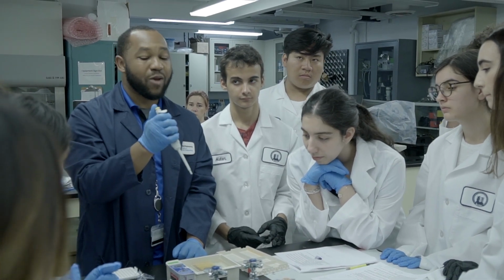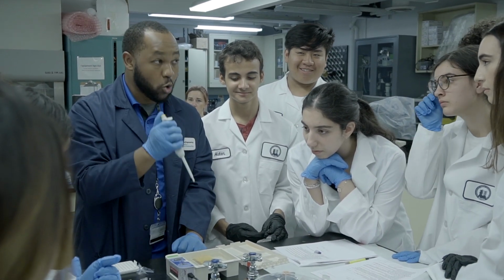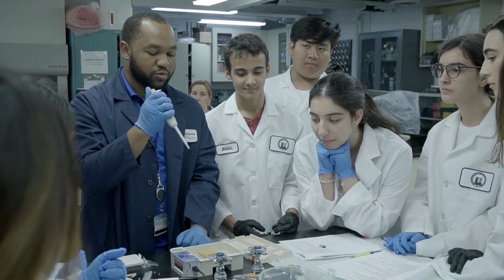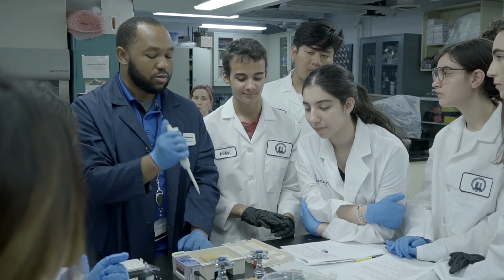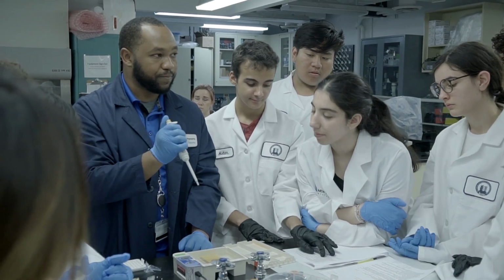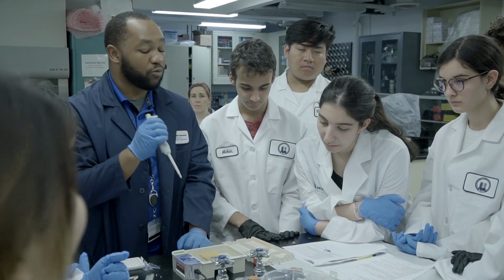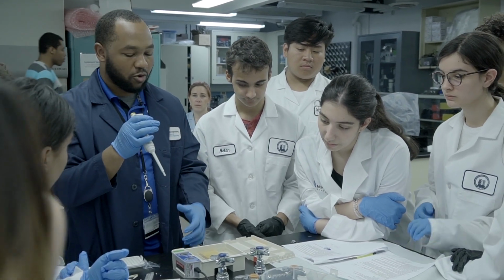All right. If you happen to press it twice, you're going to blow air into it, and that's going to mess up your sample. Okay. So just make sure you're all the way into your lane, and then very slowly eject it, and then once you're fully ejected, pull out. Okay. So we'll do it one at a time, just so we're not crowding too much.